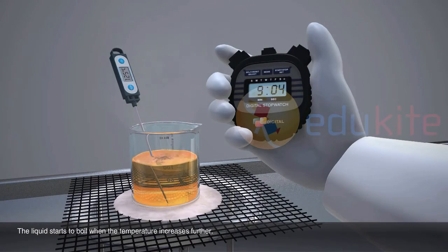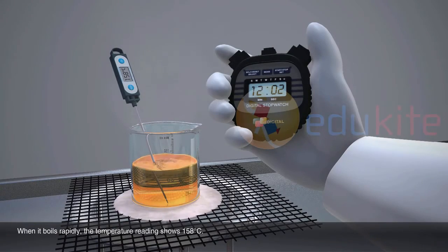The liquid starts to boil when the temperature increases further. When it boils rapidly, the temperature reading shows 158 degrees Celsius.